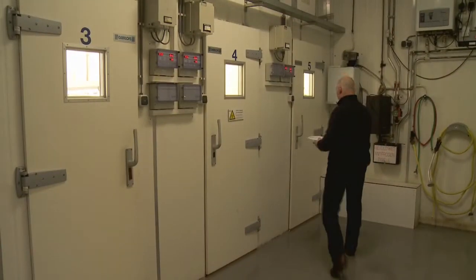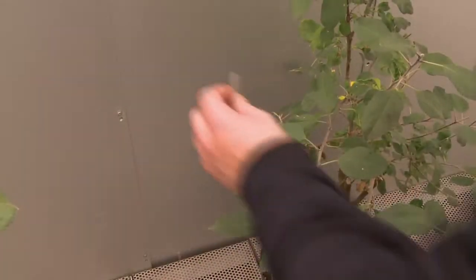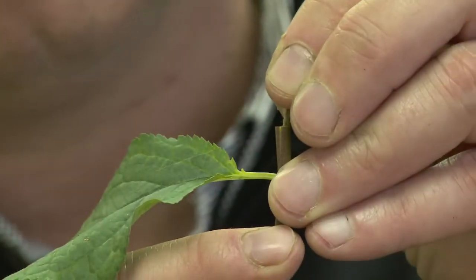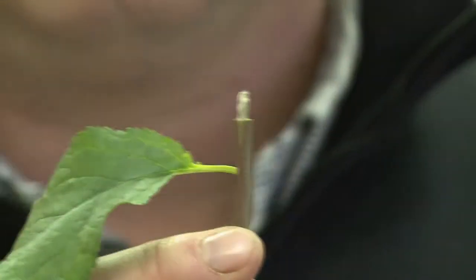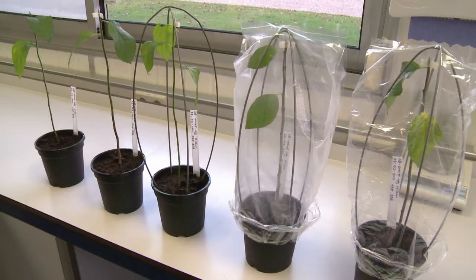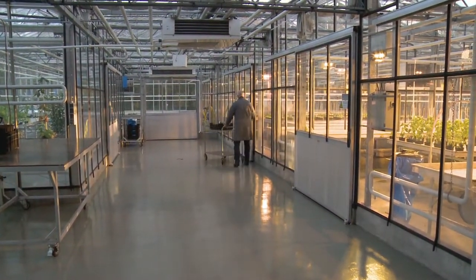Heat treatment can be applied to produce virus-free plant material for woody crops like, for example, apple and pear. Due to the enhanced temperature, growth of the plant is increased. The viruses cannot keep up with the speed of growth and the top tip of the plant becomes free of viruses. This tip is then grafted onto a virus-free rootstock. A number of subsequent tests can be applied to prove the virus-free status of the plant.